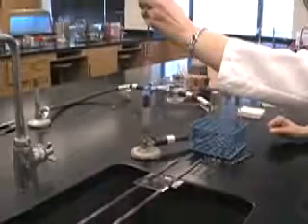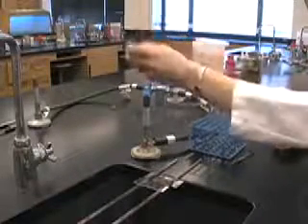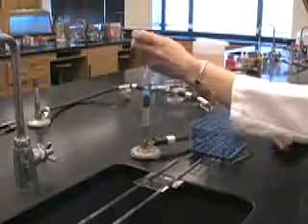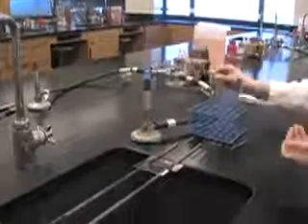Next, the slide needs to air dry, so all of the water on the slide should evaporate. You'll know the slide has air dried when you see a thin film form on the surface of the slide.